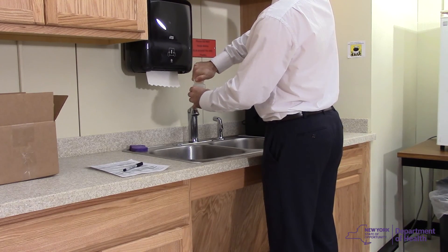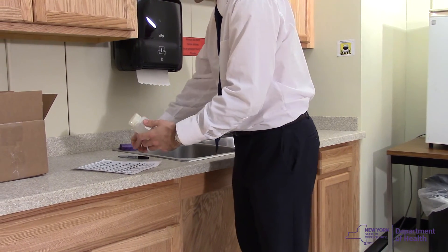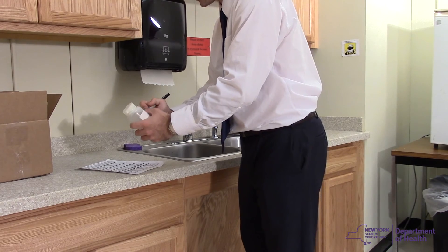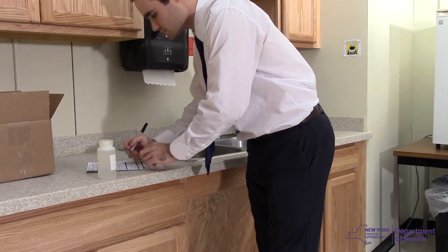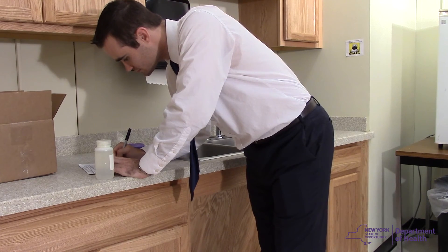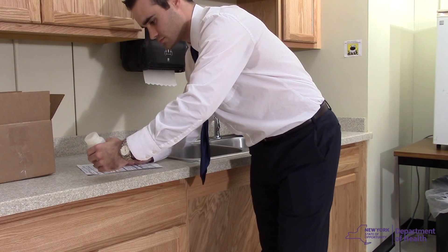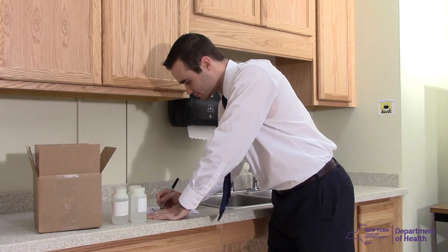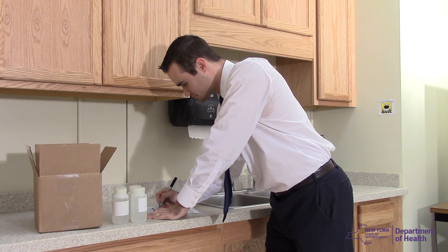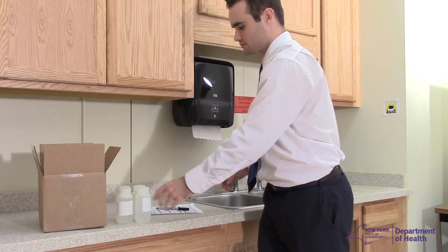Once the sample bottle is full, securely cap the bottle. Record the time the sample was collected on the sample bottle as well as on the chain-of-custody form. Make sure that the information on the bottle is the same as what is recorded on the chain-of-custody form. Print clearly and legibly so that lab personnel can easily read the sample information. Record any observations that may affect the sample's results — for example, leaking outlets, discolored water, low water pressure, etc.